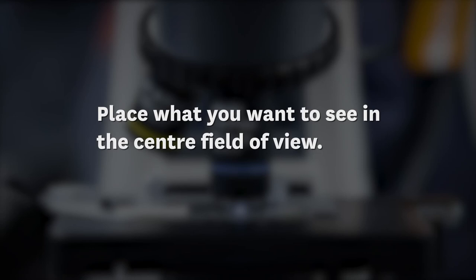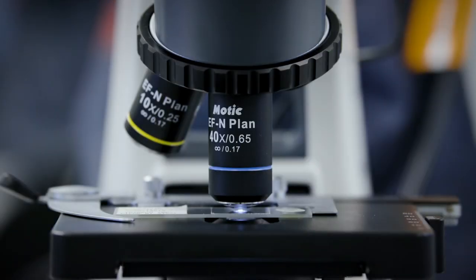It's very important to place what you want to see in the centre field of view, because when you increase magnification, the image size increases but a smaller area of the object is covered in the field of view. It may fall out of the field of view if it's not centred first.